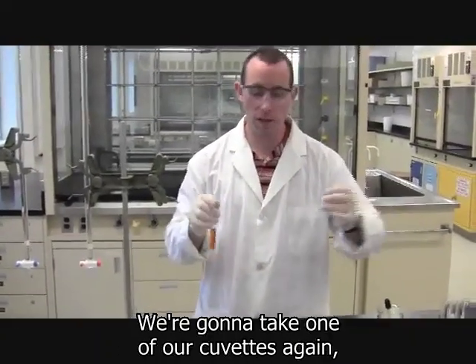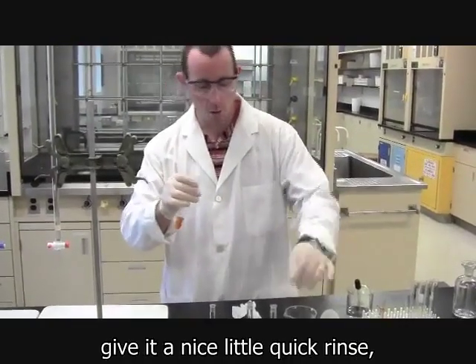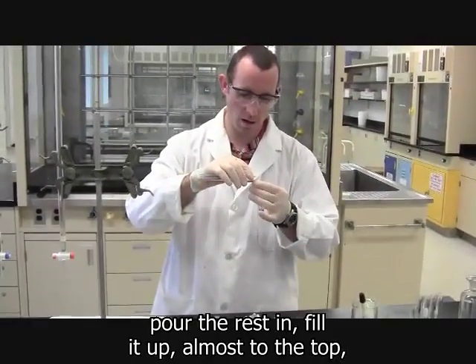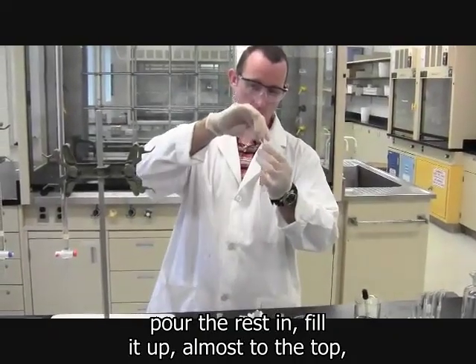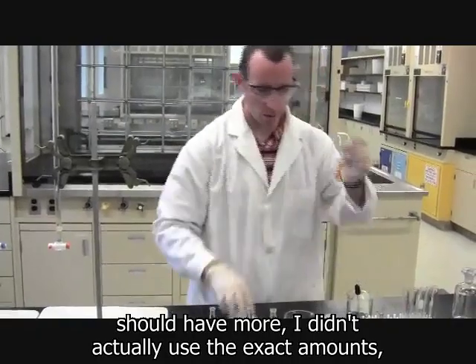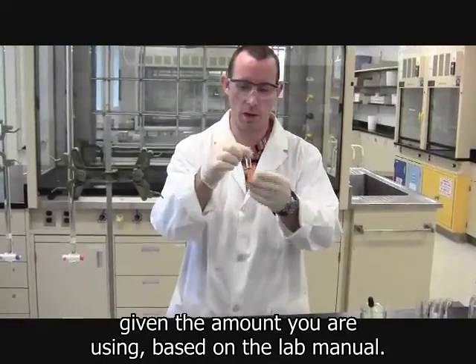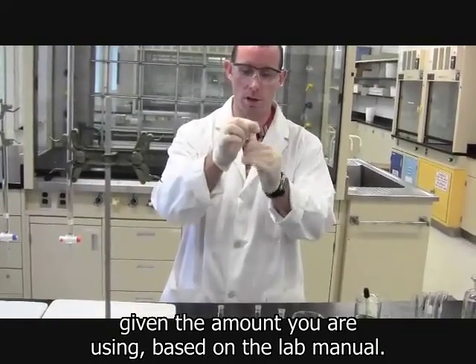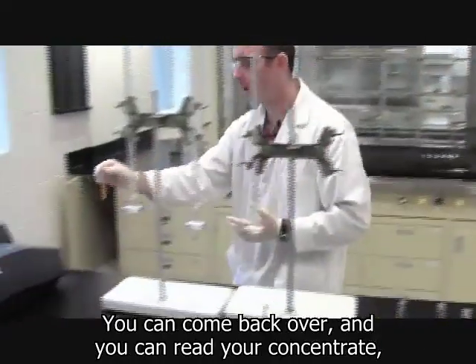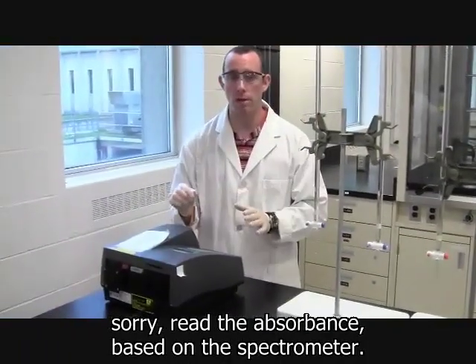We're going to take one of our cuvettes again and do the exact same process. Pour a little bit in, give it a nice quick rinse. Pour the rest in, fill it up almost to the top. Should have had more. I didn't actually use the exact amount, so it should be a little bit higher than that. You should have plenty when you're doing this part of the experiment, given the amount you're using based on the lab manual. You can come back over and read the absorbance based on the spectrometer.